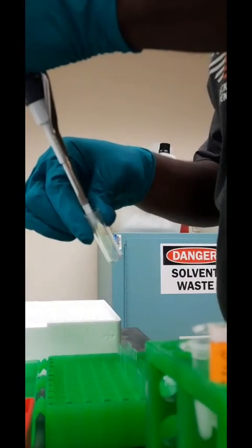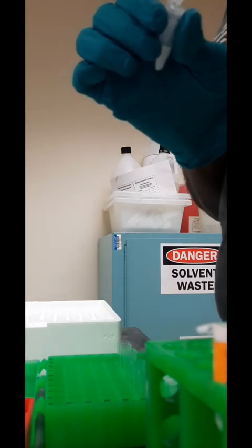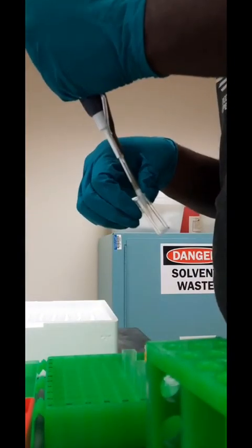I'm comparing some non-modified nanoparticles to some ones that I've made several modifications to. So each of these samples is one of those. I make sure to add the nanoparticles to the bottom of the cuvette to make sure they all go into solution when I add water.